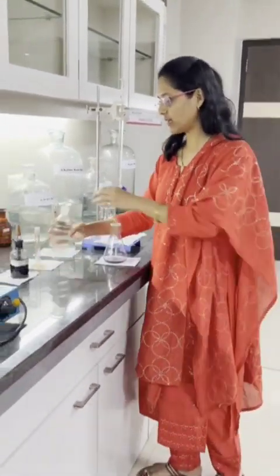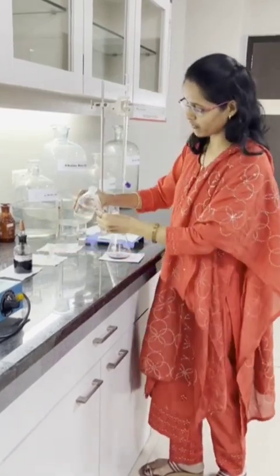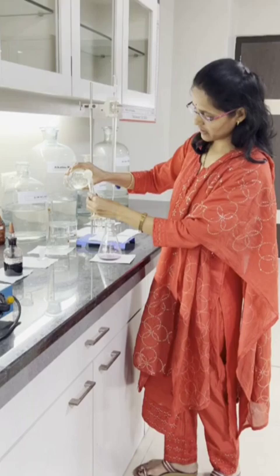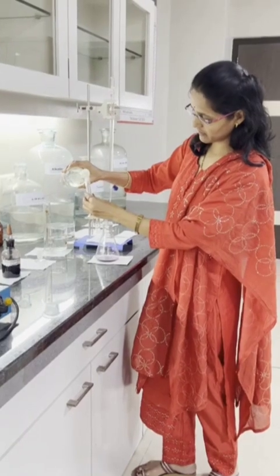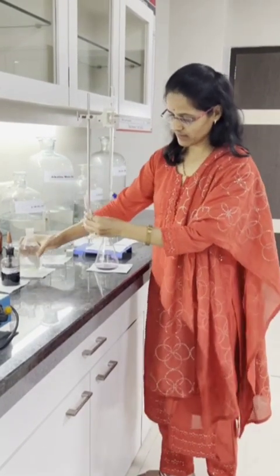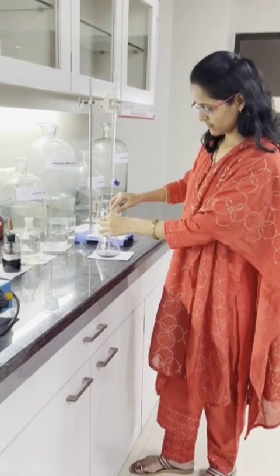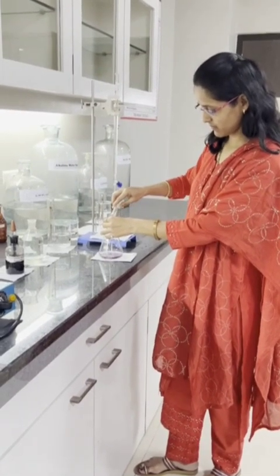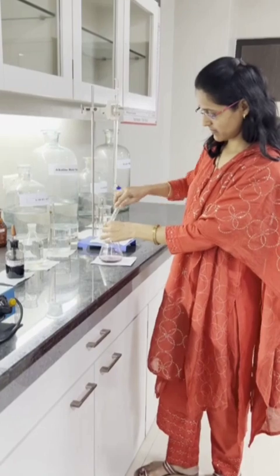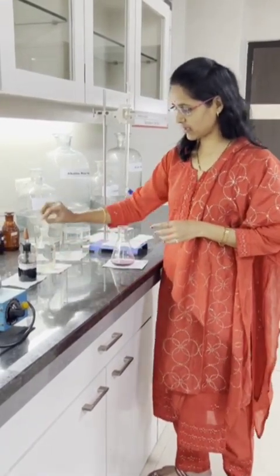Now we have to add 10 ml of buffer solution which has pH 10. This is the buffer solution which has pH 10.